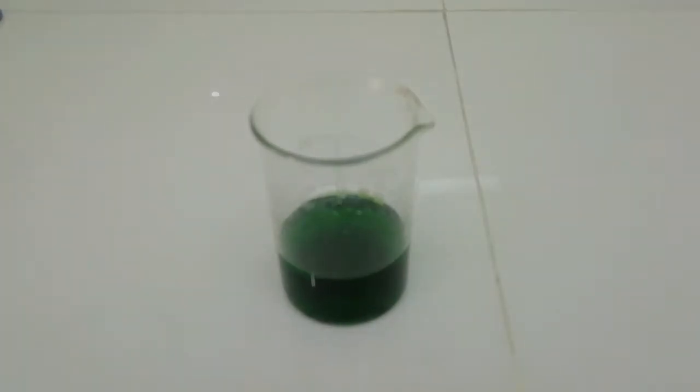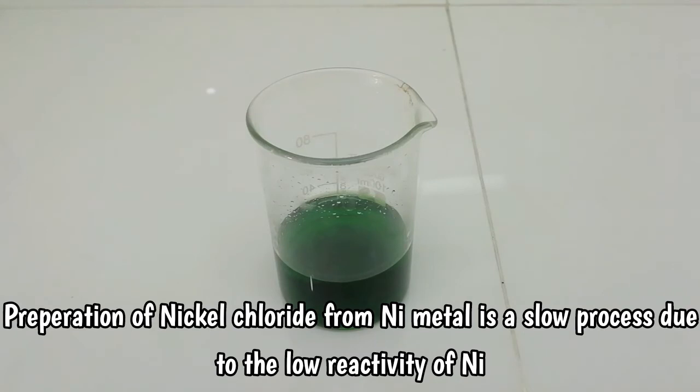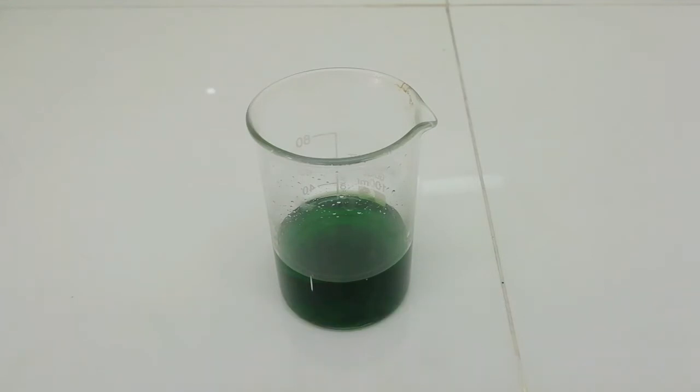Now you can see here this is a solution of nickel chloride. I have to mention that after about one hour I realized that the reaction is too slow, so I just stopped the heating then I kept this solution in a warm place for three days.